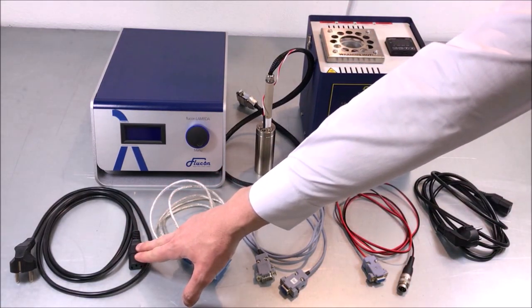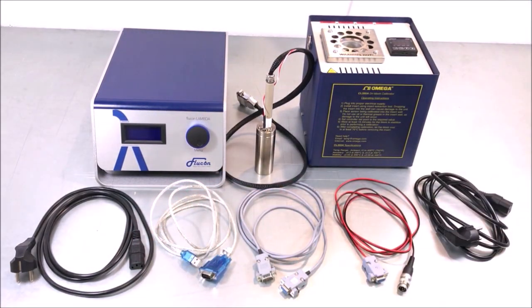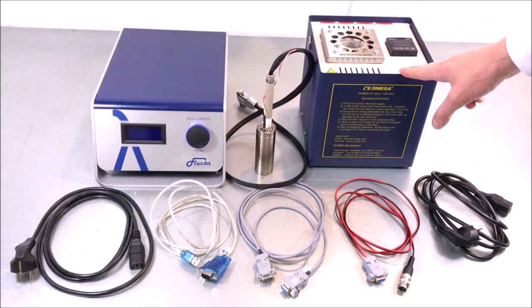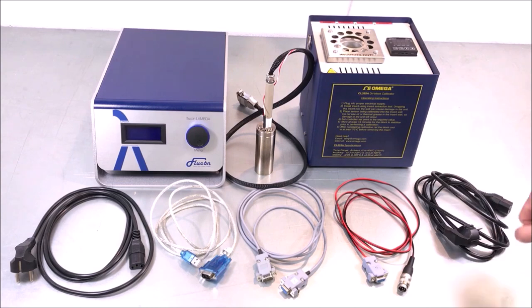There is a mains cable for the power supply of your system. For automatic temperature control of your samples, you have a dry block thermostat as well as another mains cable for it.